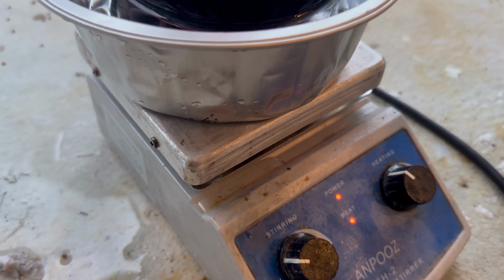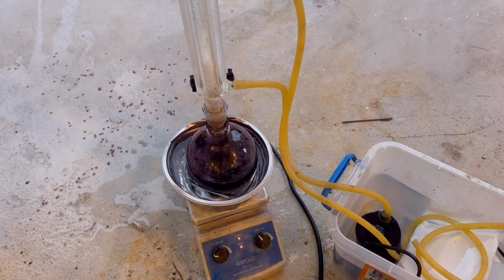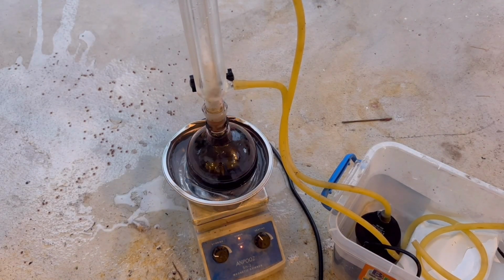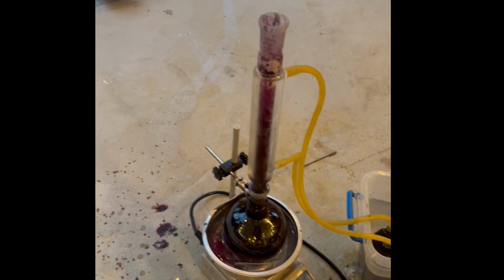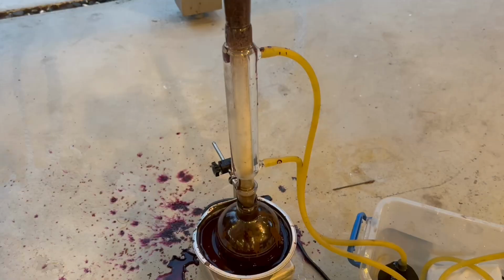Yeah, things are really heating up now. Let's go. Then my condenser decided to vomit everywhere. I don't know what that's about. Whatever was happening there must have released a good amount of heat, as all of my naphthalene decided to migrate from my flasks to my condenser.